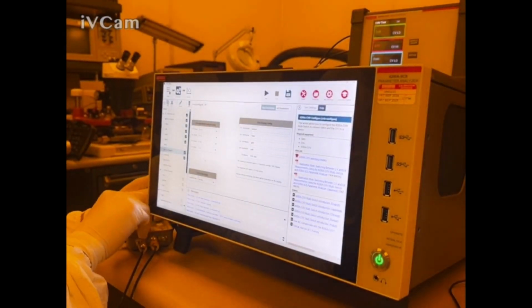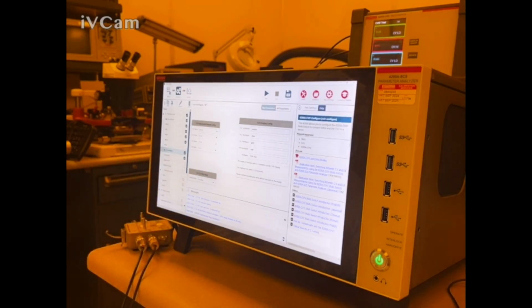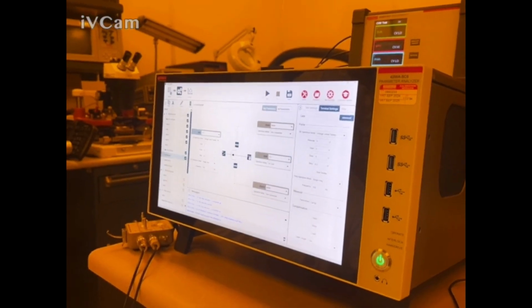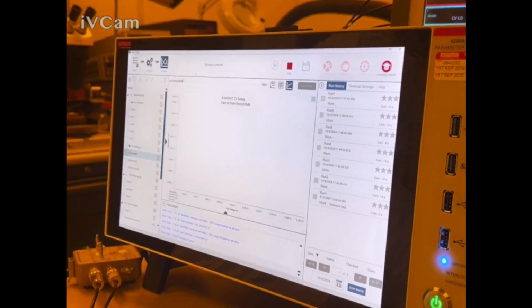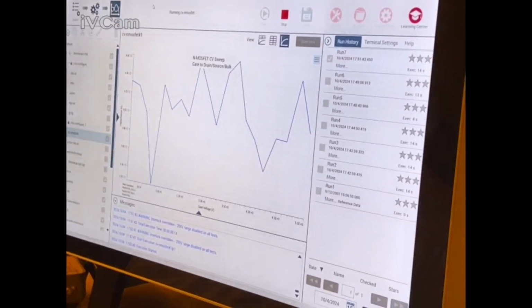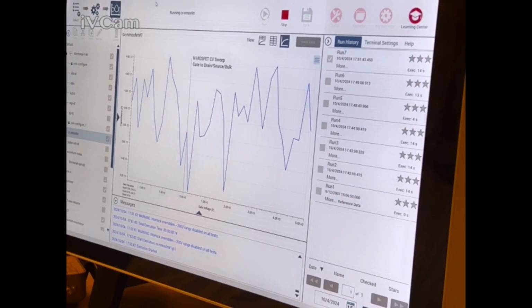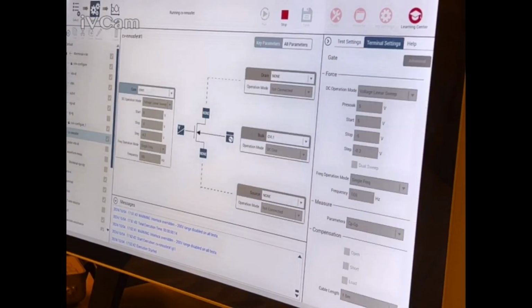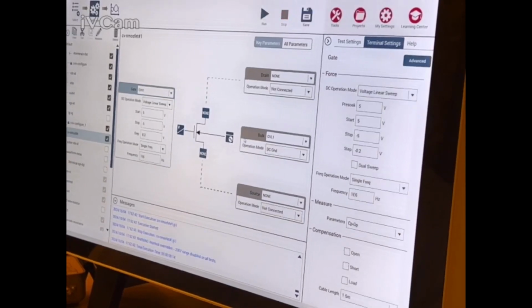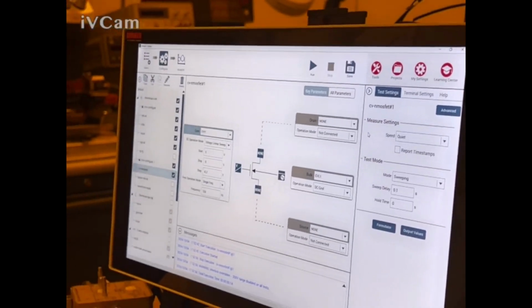Okay, let's try this device. I don't know why that's not working. Configuration, something is not right. Can we do a simpler measurement like a CV? It doesn't get much simpler. Can we visualize the CV sweep? No.